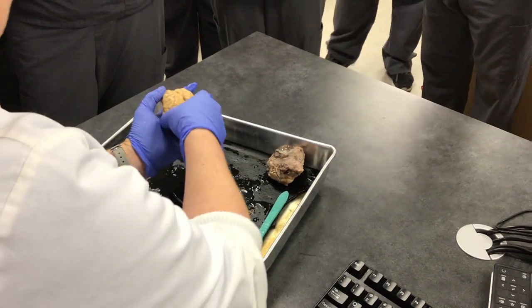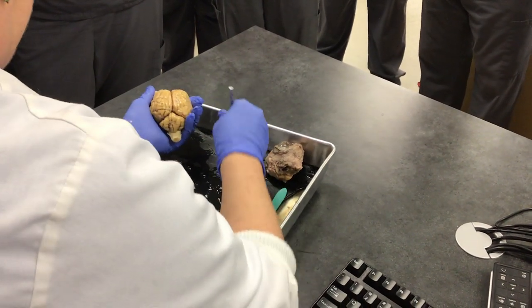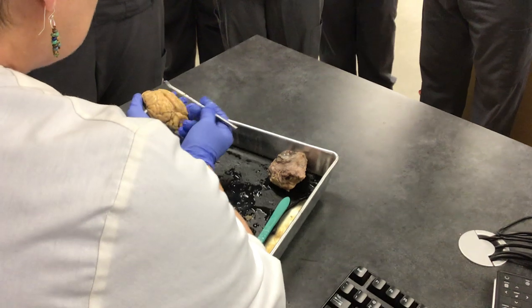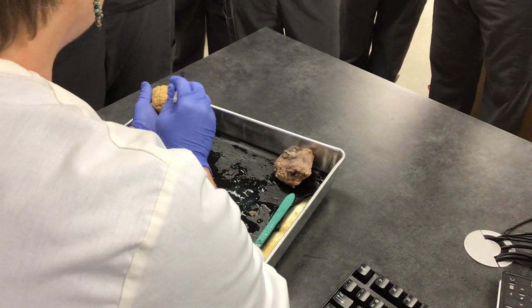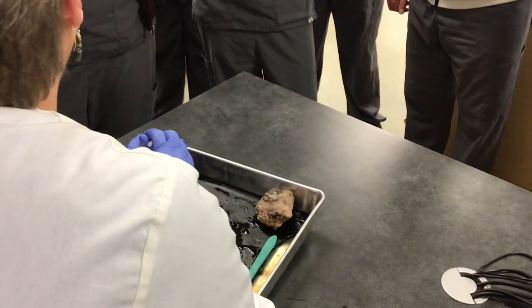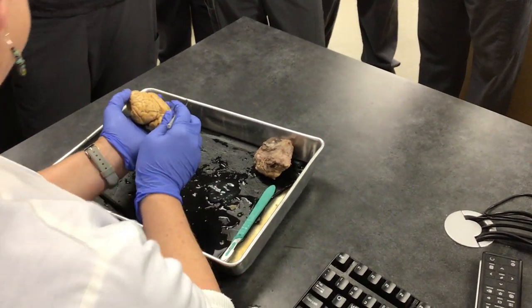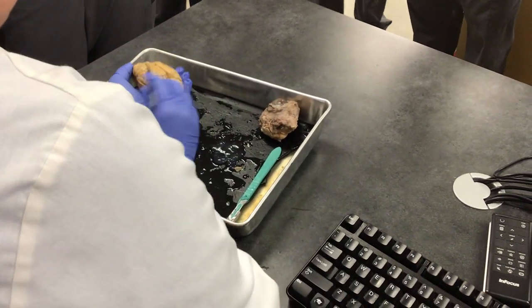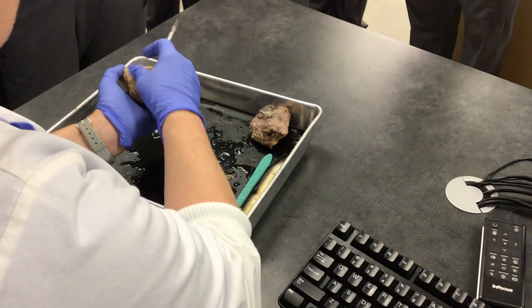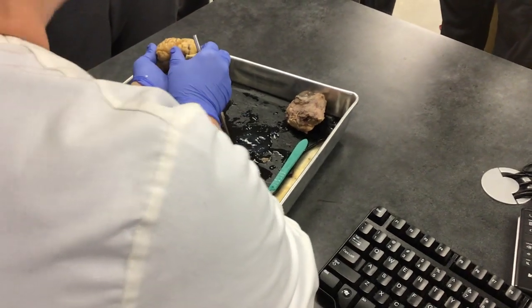Now it's the brain. This is the posterior side and this is the anterior side. What are these called? The right and left hemispheres — and of what? It's the cerebrum.